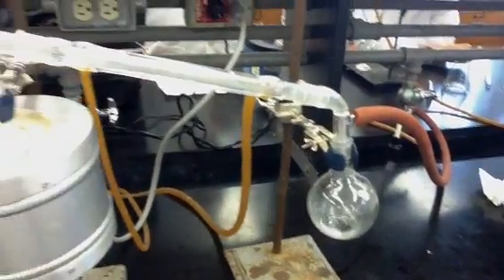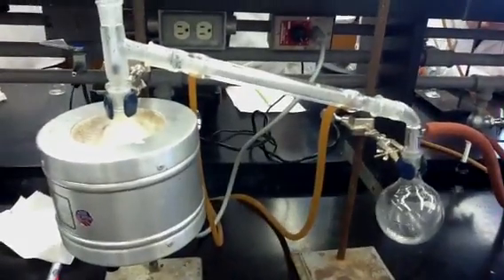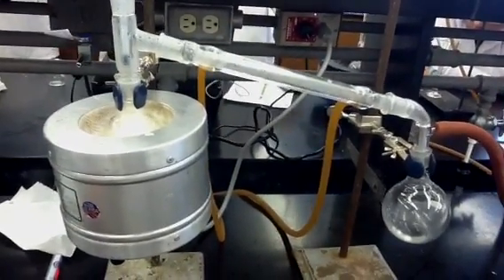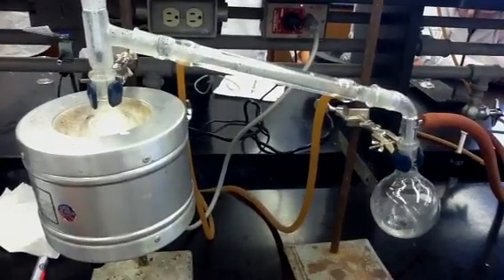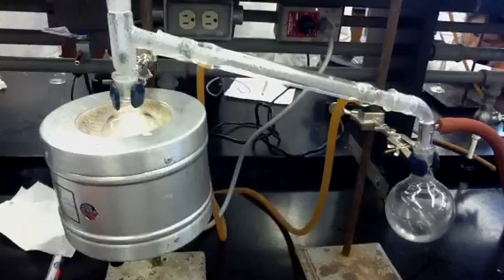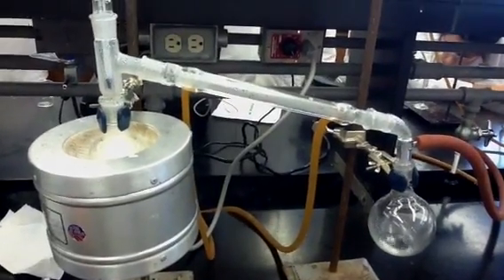It's also a good idea when you turn on the heating well to just turn it on halfway, and make sure the benzaldehyde doesn't boil over too quickly. If it starts really getting volatile, it can create what's called bumping. Not only can that wreck your experiment, it can also wreck the equipment. So if you see the benzaldehyde becoming really volatile, just turn down the temperature.